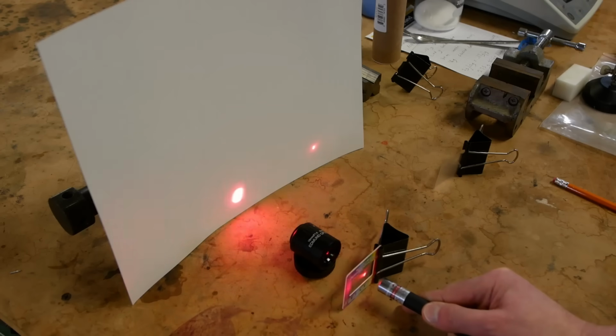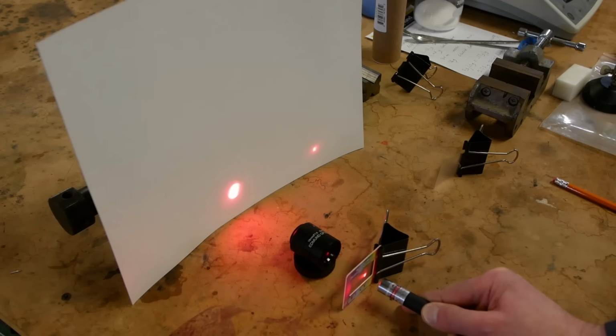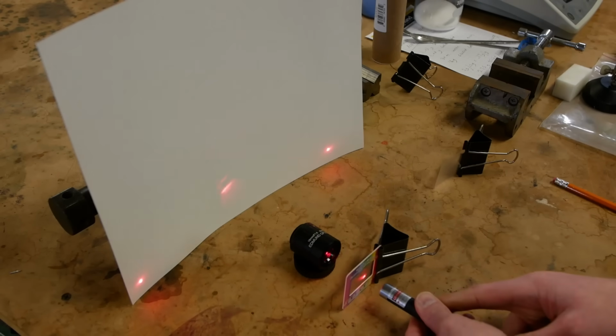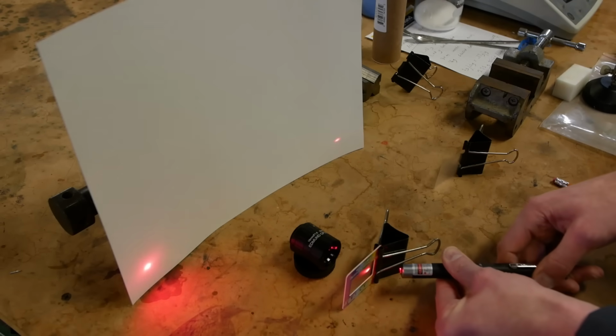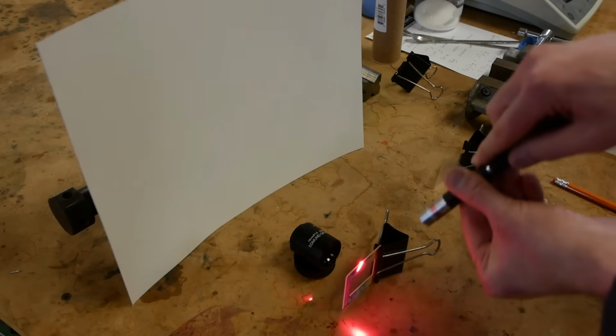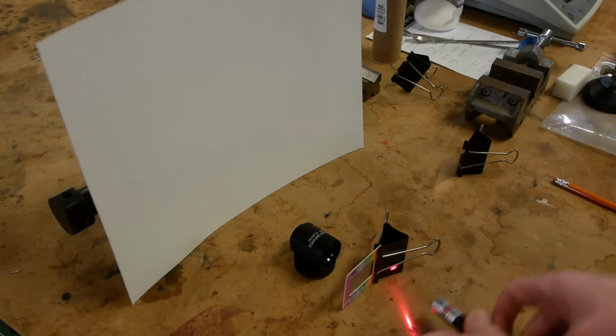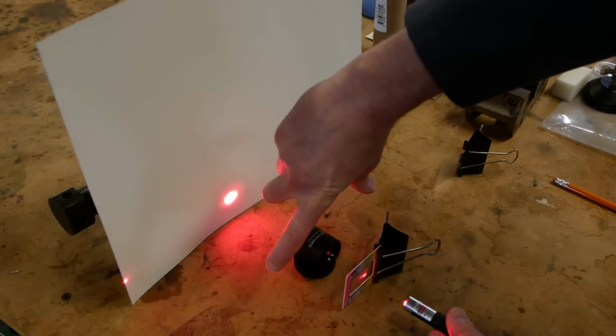And so this whole technique of Fourier Ptychography is capturing all these different spatial frequencies using a small lens and then putting them all back together. So it's basically like having a huge lens because we've swept through all the different angles of possible diffraction. And remember, this is happening in 2 dimensions. So we're sweeping vertically and we're sweeping horizontally. And we're putting all of this together as if our lens were enormous.